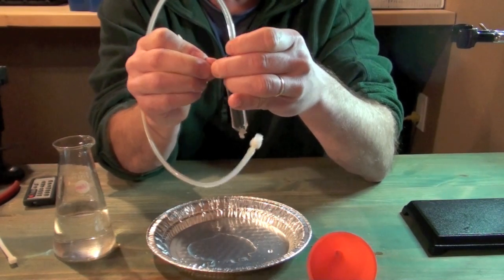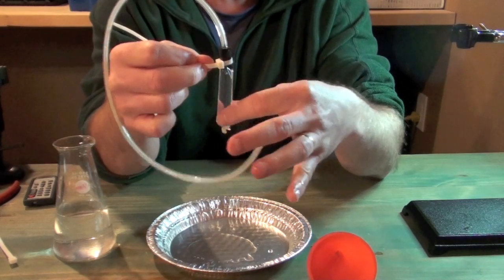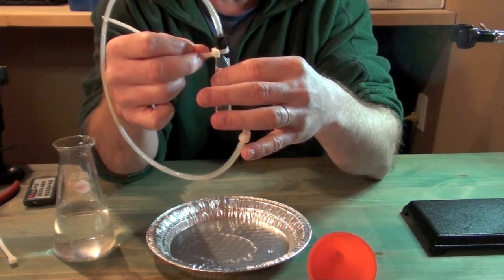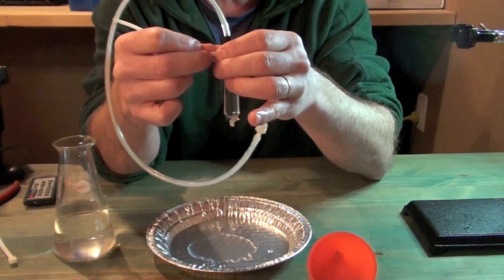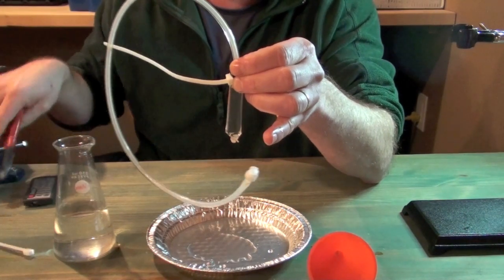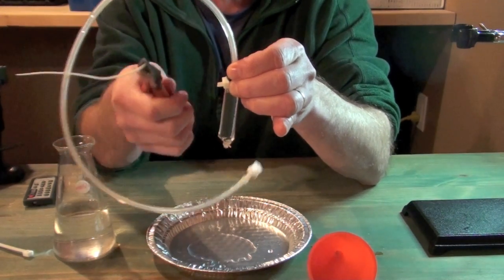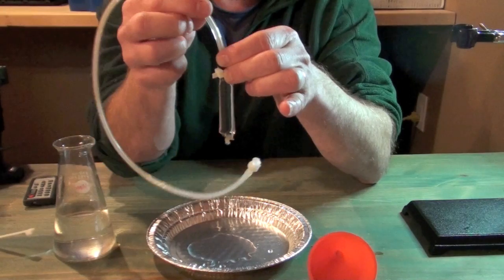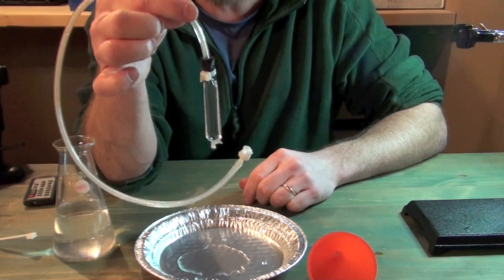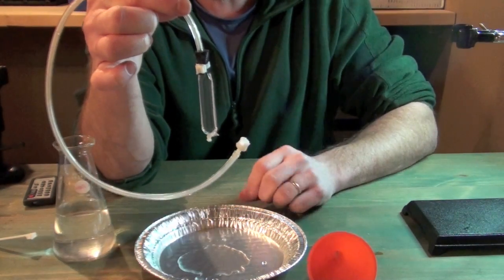And what I end up with is a really beautiful seal around my baggie. I can even test that slightly by giving it a slight squeeze, and I can feel that there's no water escaping. I just get a little bit of solution coming up the tube with my gentle squeeze. Okay, and then again, if I'm a neat nick, I can snip off this excess zip tie material. Just like that. And what I have now is a really beautiful dialysis baggie set up where I am ready to insert this into my surrounding solution.